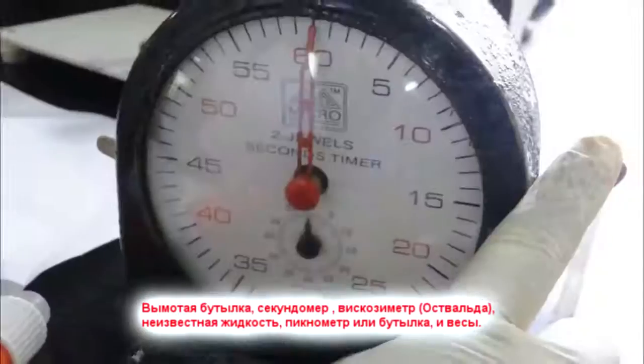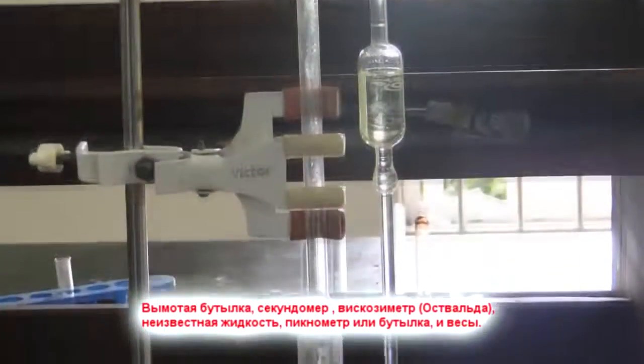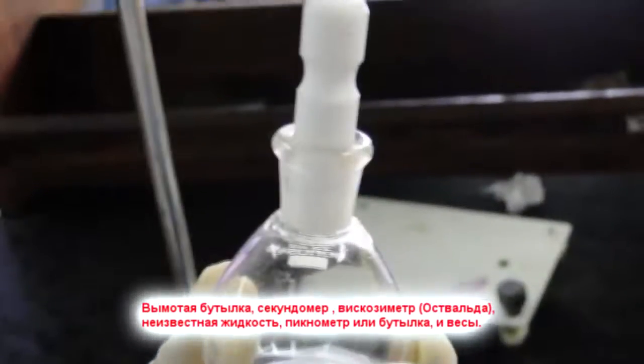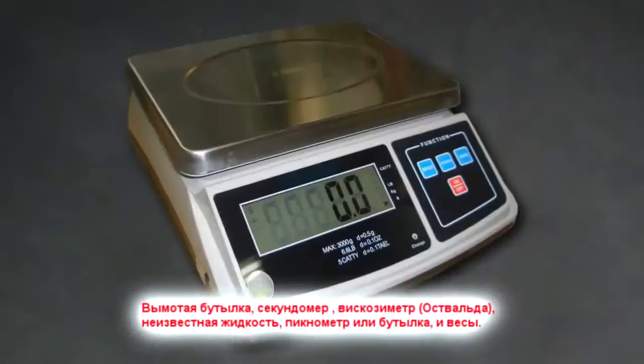Now the apparatus used: wash bottle, stopwatch, Ostwald's viscometer, unknown liquid, pycnometer or RD bottle, pipette, and a weighing balance.